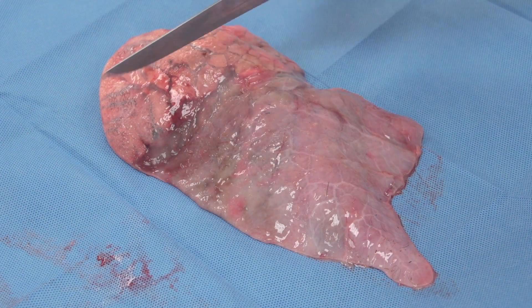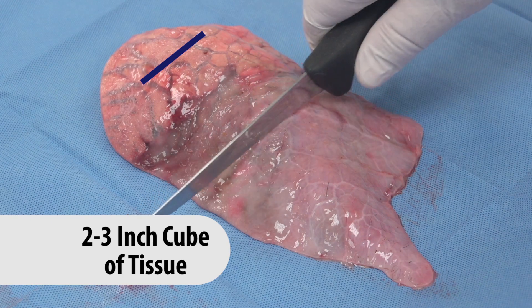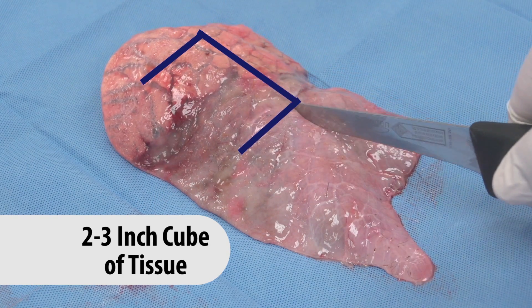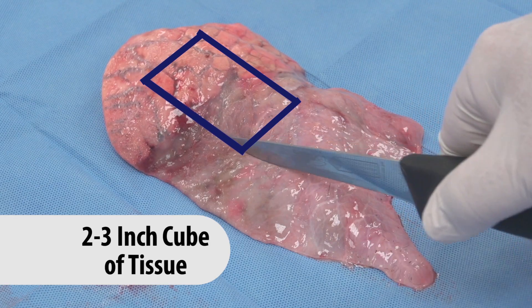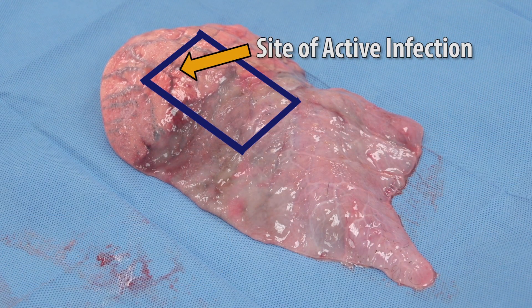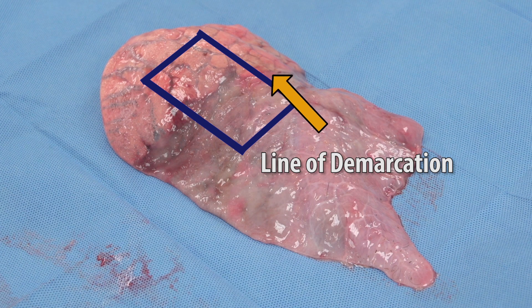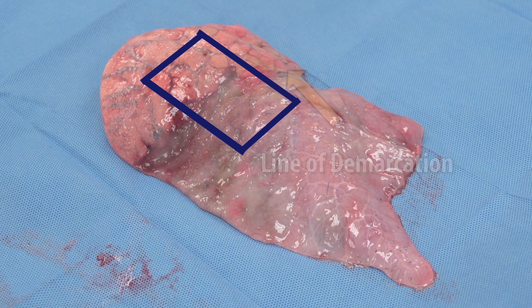A single section — at the very minimum a 2 to 3 inch cube of tissue — is generally adequate for PCR. Tissue sections should be taken from the site of active infection. This is generally along the line of demarcation of normal and abnormal lung.